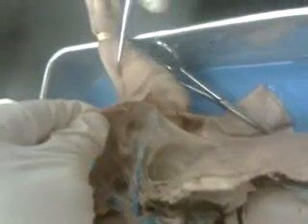And in fact, you can actually see here it is. There's the subclavian artery. There is the subclavian vein that's coming out of there as well. And if we can continue on down in here, then when it enters, and you can pick on this a little bit more later, it just continues on, becomes axillary artery and vein. Now, this is the umbilical vein. It's been cut. That's fine.